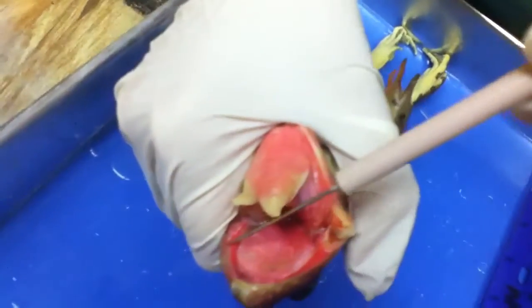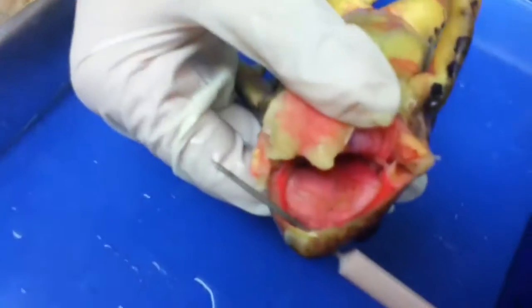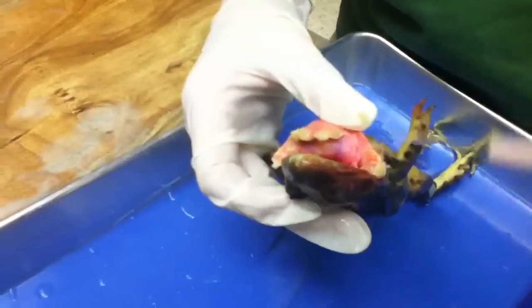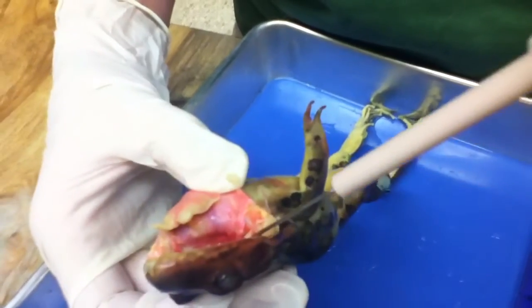Maxillary teeth — right here? Does it really feel like sandpaper? Yes, it actually does. Internal nares — we already found those, right? They're right here, right there, where the needles came to. The Eustachian tube is right here. They're the lines around the esophagus. They're right here — goes to his ears. Oh, it does? Okay.